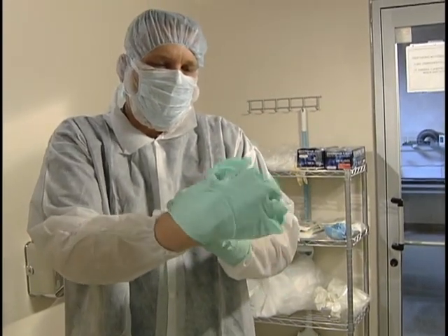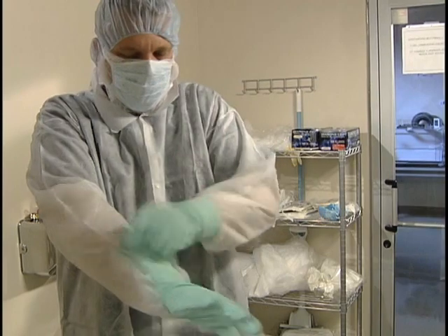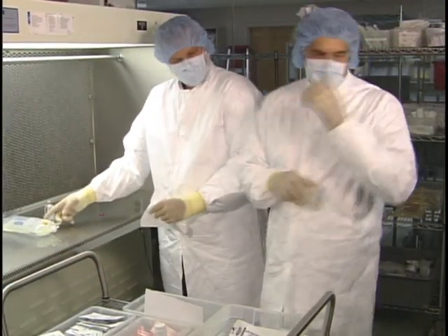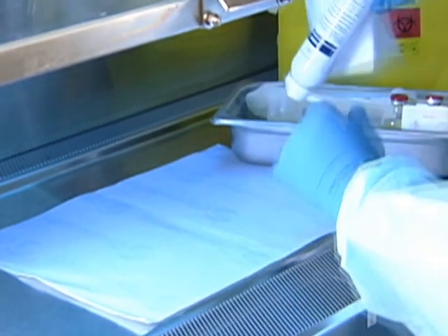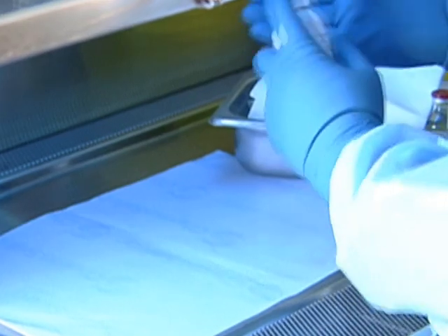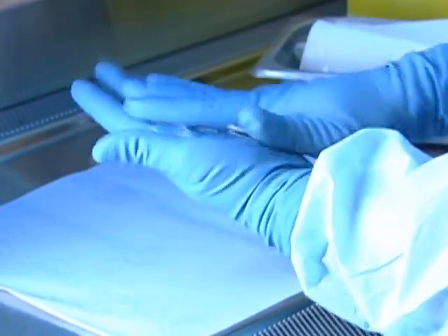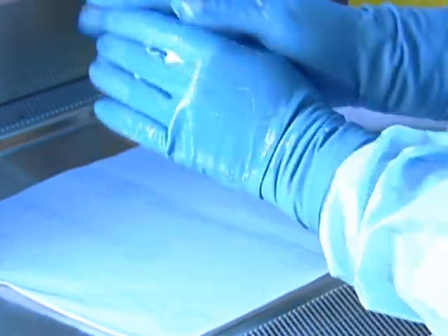Many institutions require the use of sterile gloves to reduce touch contamination, but don't let that give you a false sense of security. Sterile gloves are sterile only until they touch something not sterile. If you must scratch or touch your face while wearing gloves, they will need to be changed or disinfected. Please note that if you have an upper respiratory tract infection, open sores on hands, or any other infectious disease, inform your supervisor or consult your institution's quality assurance procedures.